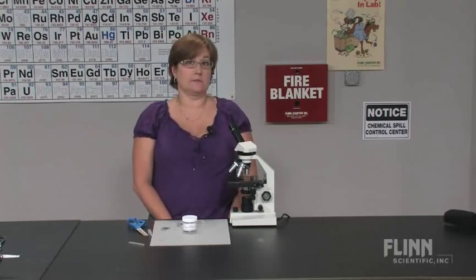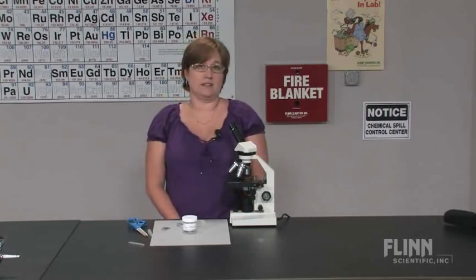Volvox are one of the most interesting microorganisms that can be used in a classroom.